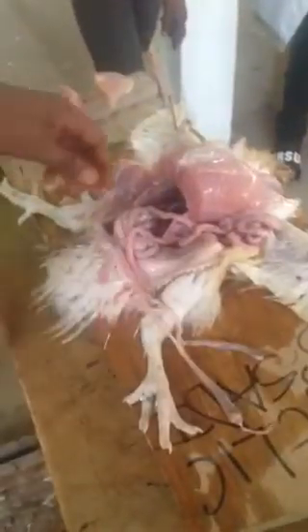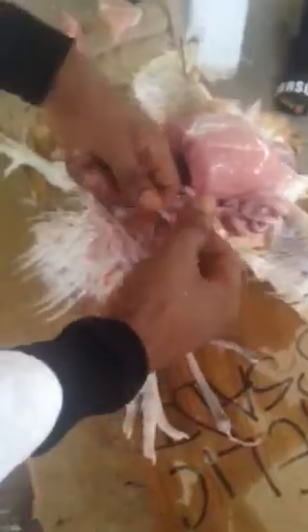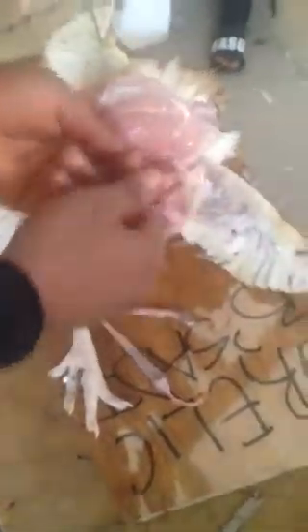Please, the diverticuli should be kept conspicuously for your examiner to see, to know that you have displayed the diverticuli. From the diverticuli, you have to move upwards. Upwards, you have what? The small intestines. At this level, now look at what I'm doing here, please. At this level, I'll advise you not to destroy these mesenteries.